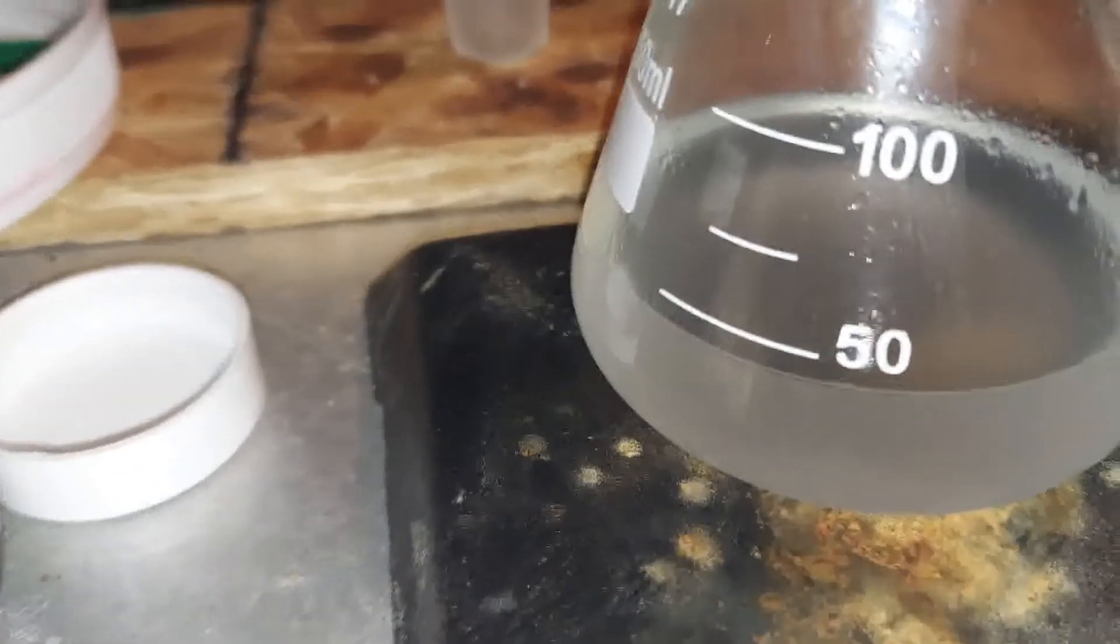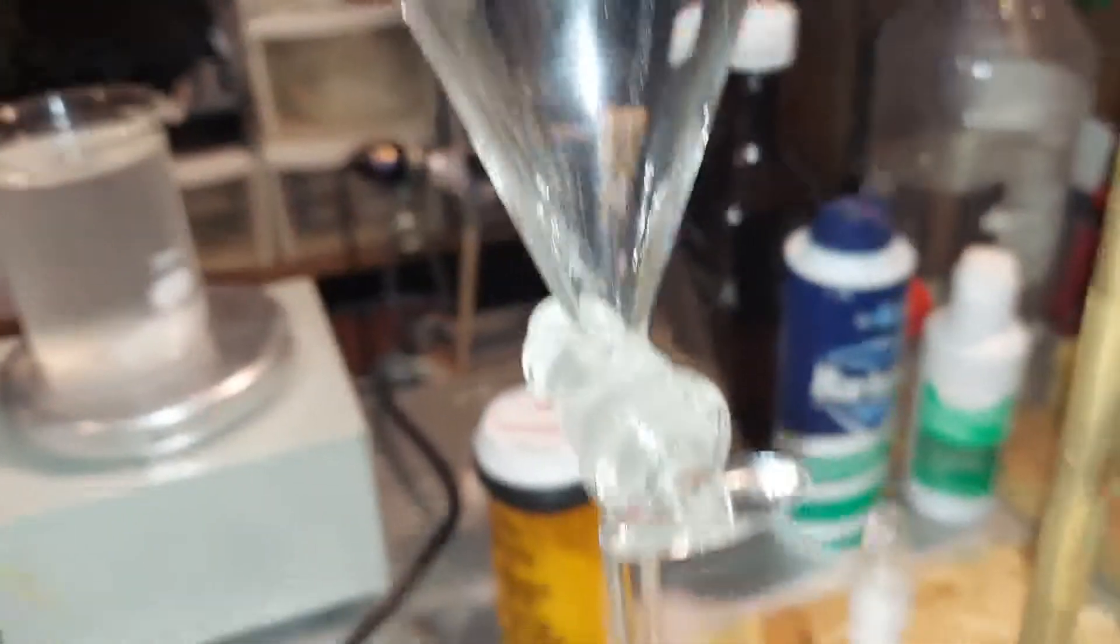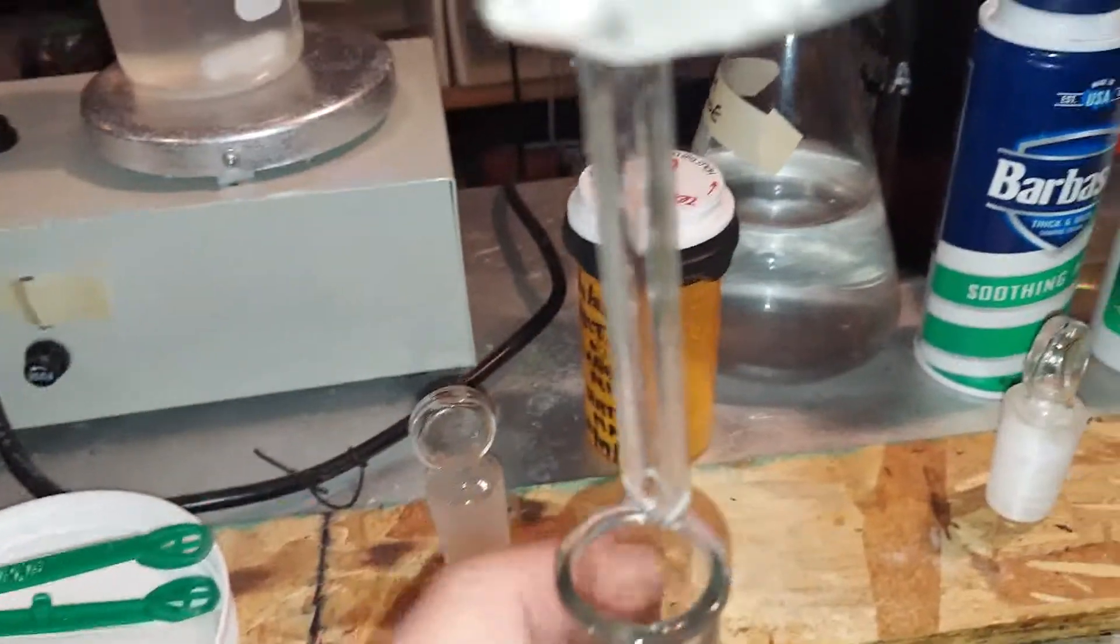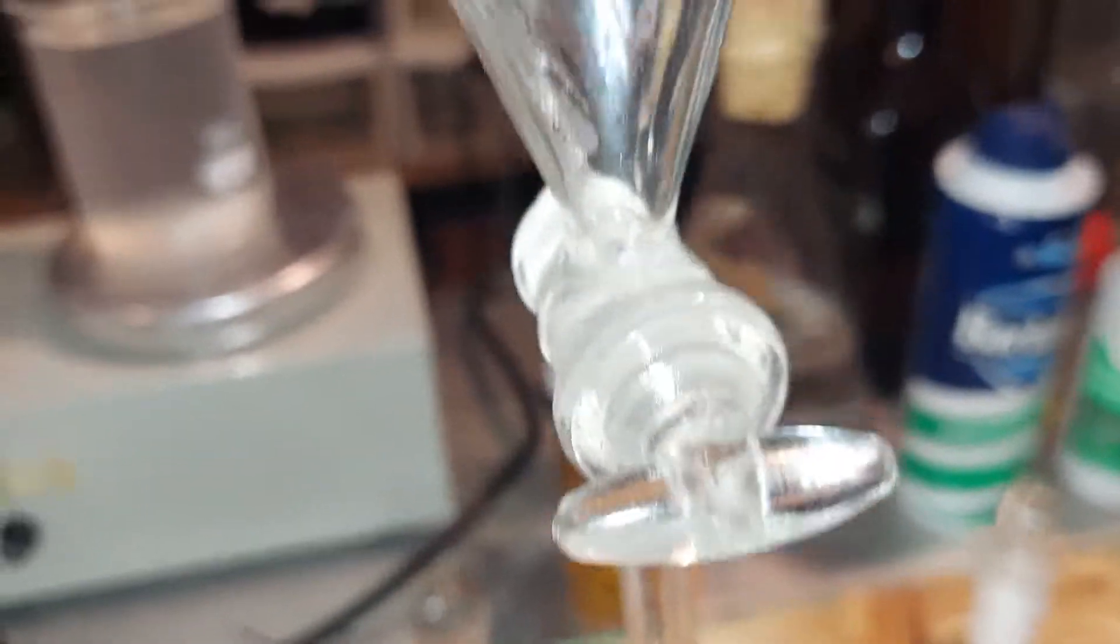I drained the bottom layer out of the separatory funnel here, which is the chloroform. And at this point I emptied out all of the other solution that was above it. I need to pour this back in here.